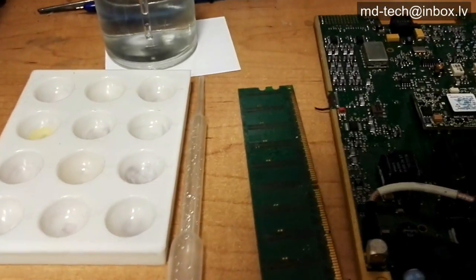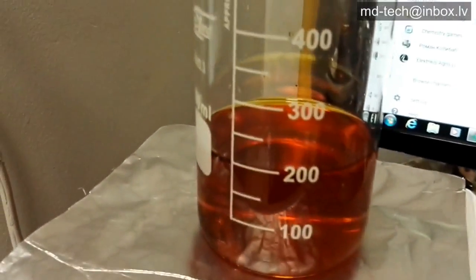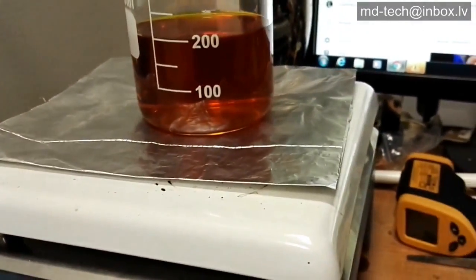Hello friend! Today a story about salt stripping and gold, palladium black powders. I have this red brownish liquid. It contained gold and maybe palladium and platinum, because the color of the liquid is brownish.